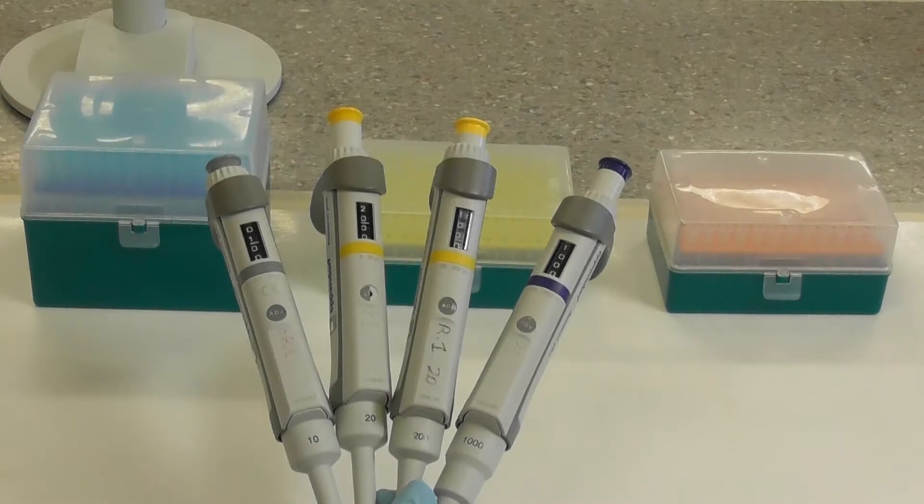In the teaching labs we use Eppendorf pipettes. You may use four different pipettes capable of dispensing different volumes. These are color coded. The grey, yellow, and blue colored tops all indicate different volumes.